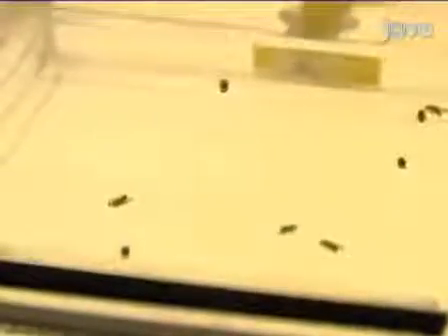Hi, I'm Justin Slawson from the Griffith Lab here at the Biology Department at Brandeis University. Today, we're going to show you a procedure for high-resolution video tracking of locomotion. We're going to use this procedure in our lab to study locomotor behavior in adult flies. So let's get started.